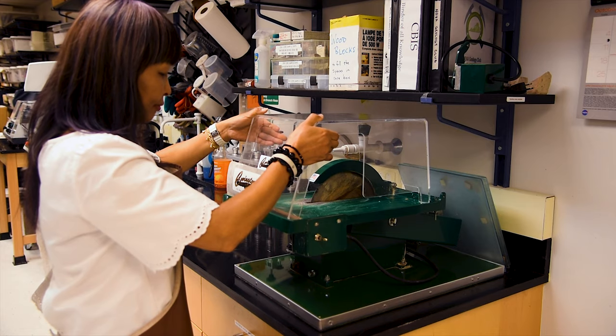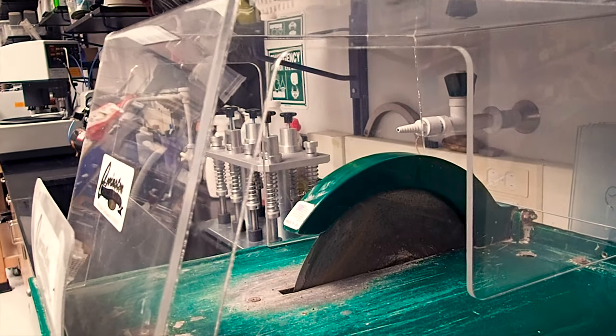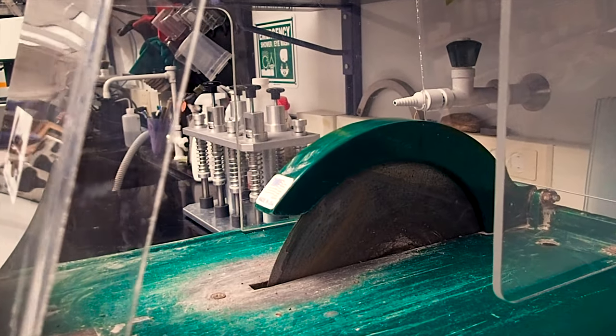When we are plugged in and ready, we will flip the power switch, located here, to turn the saw on or off. We'll fire up the rock saw later when we're ready to trim our first rock sample.